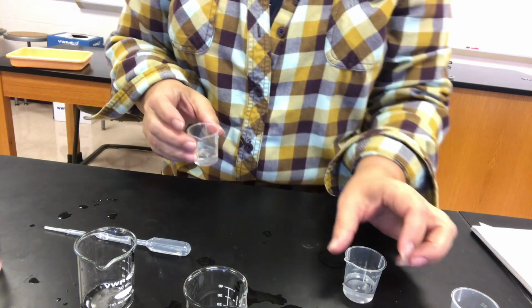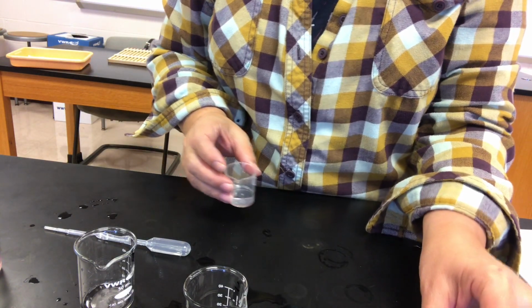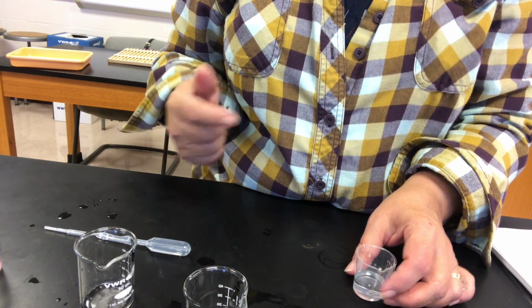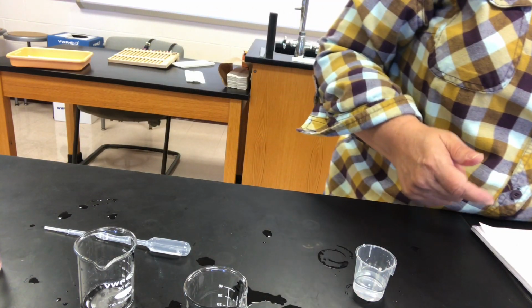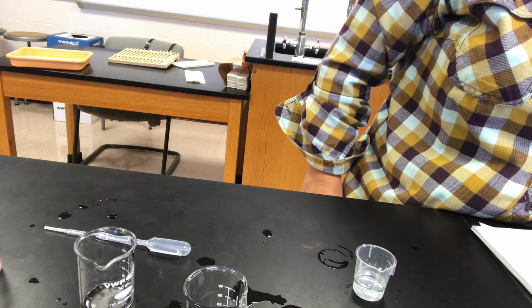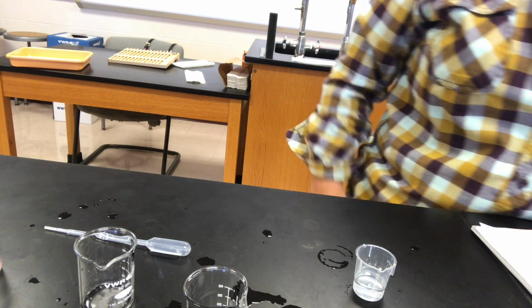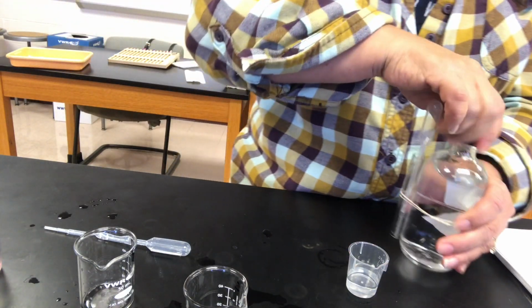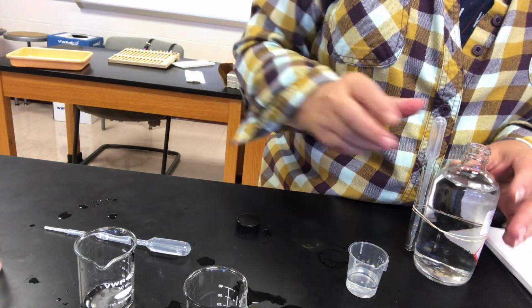Now, taking the pH of plain distilled water doesn't work well because you need dissolved ions in the water in order for the pH meter to work. So we're going to assume that the distilled water is just going to have a pH of 7. It should, right? So now we're going to add hydrochloric acid to the distilled water.